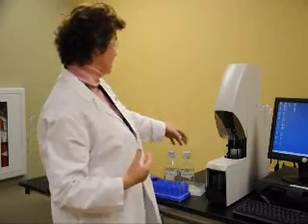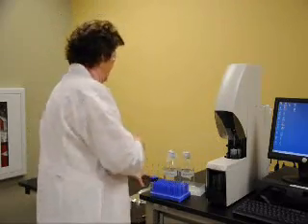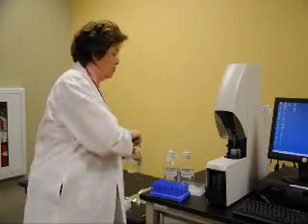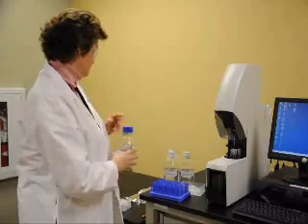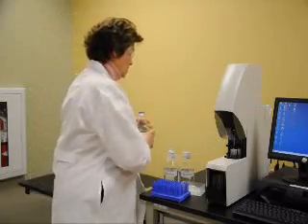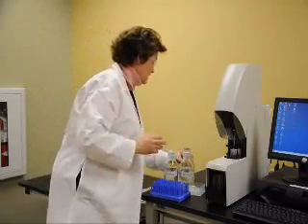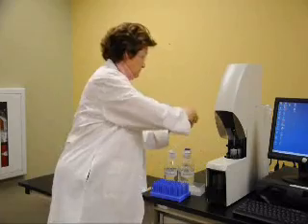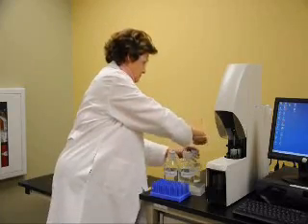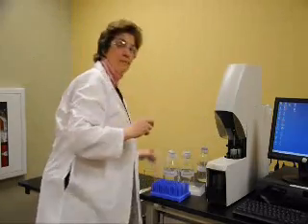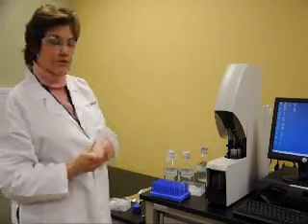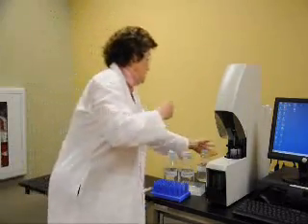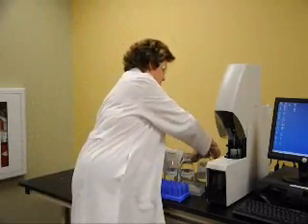And then, in addition, I've got to make sure I have reagents on the system. I've already put some of my solvents on the system. I have one more I have to put on the system. So I'll put the reagent line in the bottle. And then, typically, we'll use something like parafilm or something such as that to cover it to keep the reagent clean.